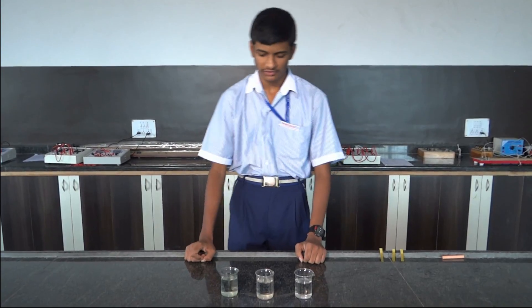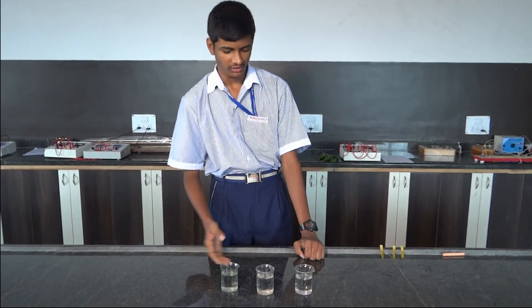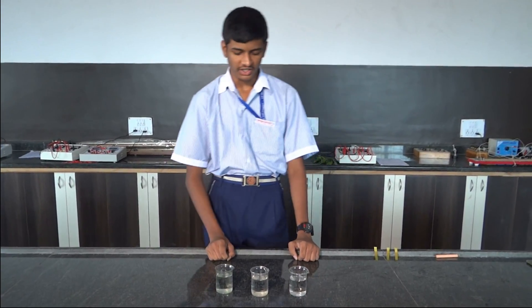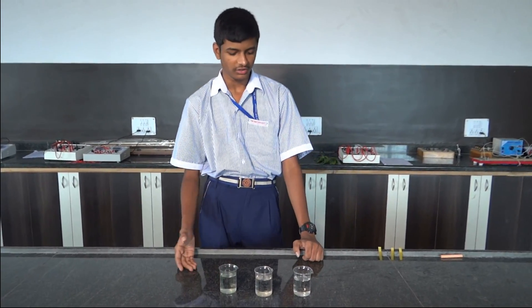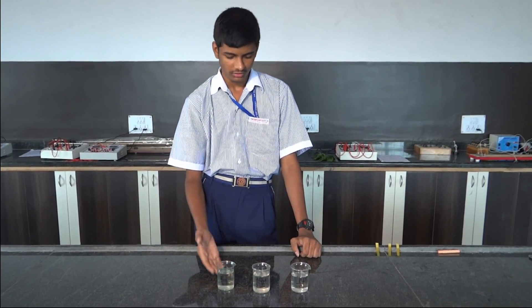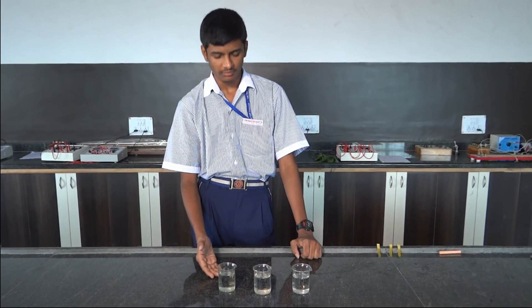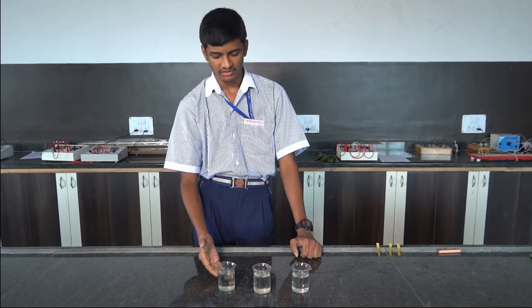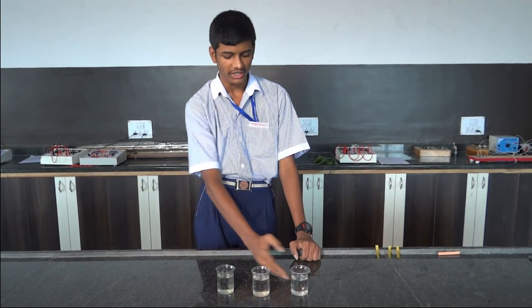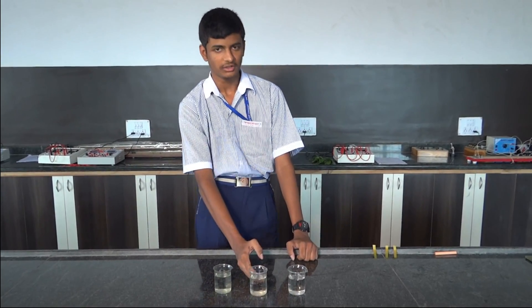First we will go through the requirements. The requirements are different water samples like sea water, well water, and pond water.